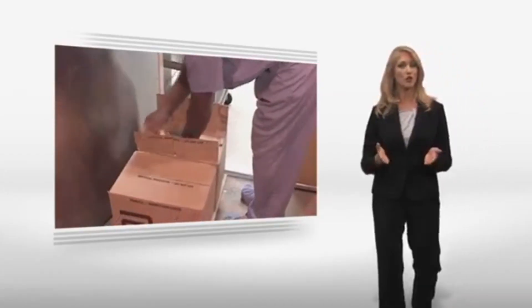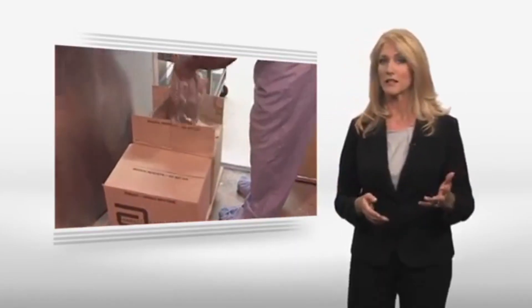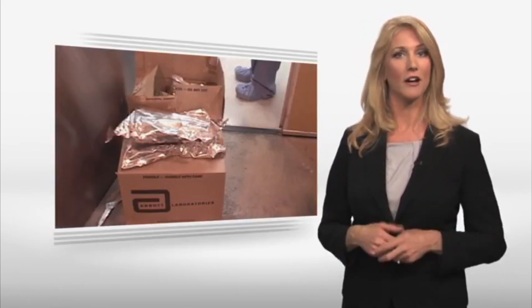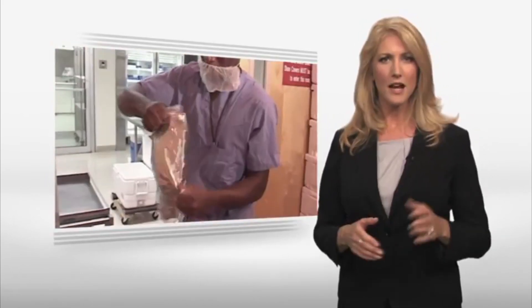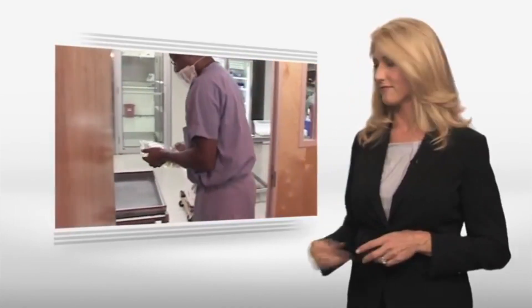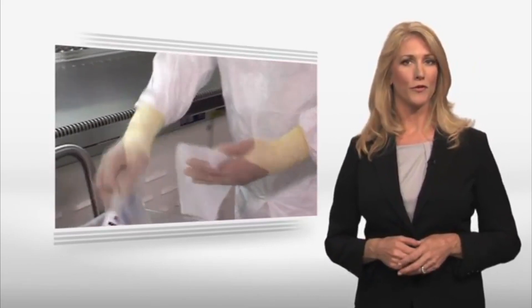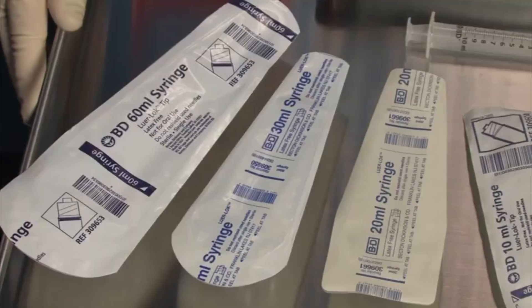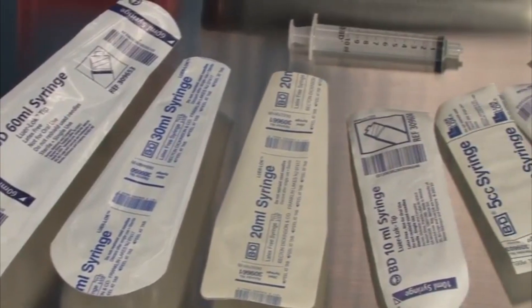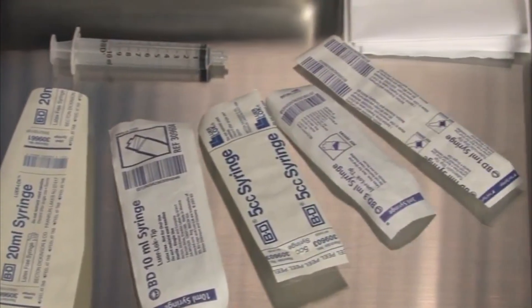Activities which generate particles, including removing supplies from cardboard boxes, should never be performed in a buffer area, ante-area, or segregated compounding area. These items should be unpacked and placed into plastic bins outside these areas. Wipe all supplies and equipment removed from shipping cartons with a suitable disinfecting agent. Sterile supplies in sealed pouches remain in the pouches until the contents are taken into the primary engineering control.